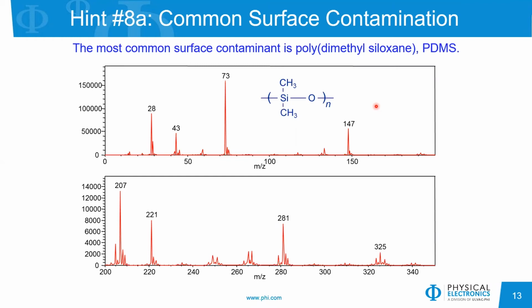But the thing about PDMS is that very little results in very large peaks in your positive ion mass spectrum. So you can have almost no PDMS on your sample, but you will see very intense peaks at 73, 147, 207, 221, 281, 325, and so on. The other deleterious effect of silicones, in particular polydimethyl siloxane, is that they are quite mobile in a vacuum environment. So even though your tape is underneath your sample, the PDMS will migrate to the surface of your sample. So it can be a problem. If you encounter this, just clean your sample holders and your tweezers and your other tools with isopropyl alcohol, and that'll get rid of it.